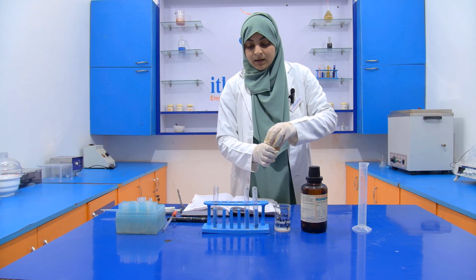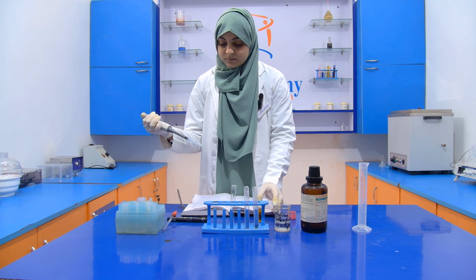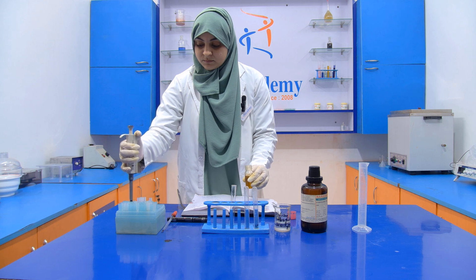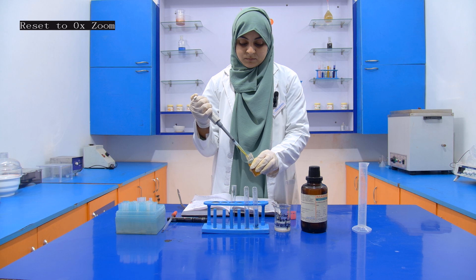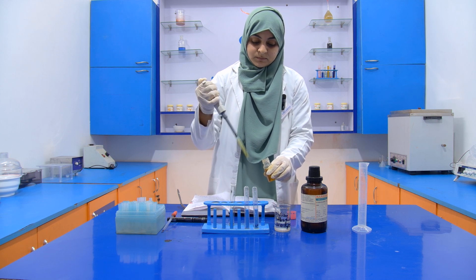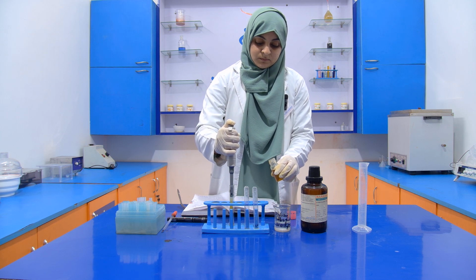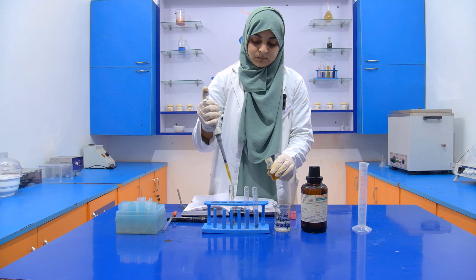So what we have to do, first of all, we have to take a sample. We require 3 ml of sample in a test tube. One, two, three. Okay.